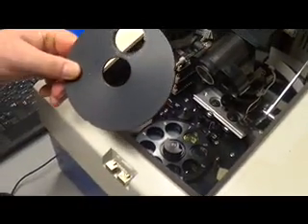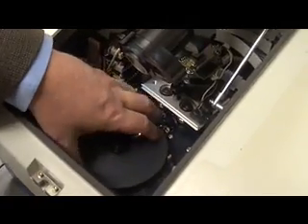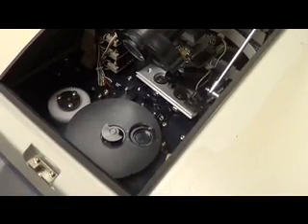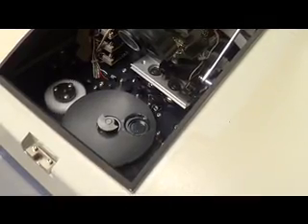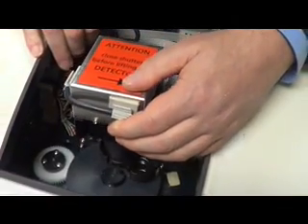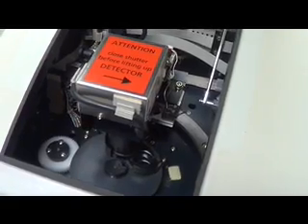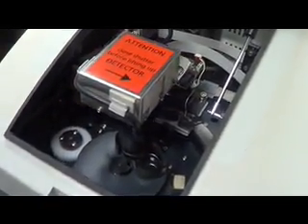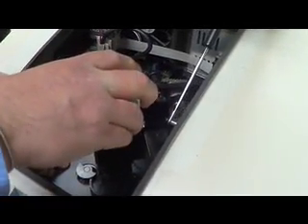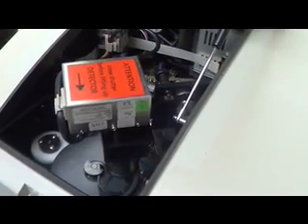Now replace the cover plate: look for the three cutouts and align them with the three pins. Once aligned, move the large circle to about the two o'clock position. Then lower the PMT by pulling on the knob and carefully letting it rest onto the filter plate. Hold the filter plate and rotate the PMT until you hear it click into place. Now you know everything has been seated properly.